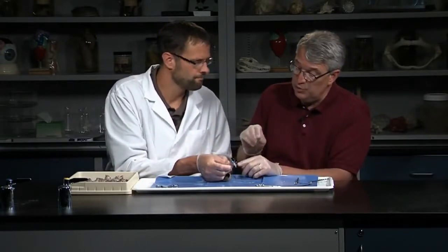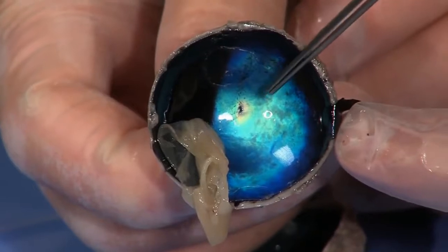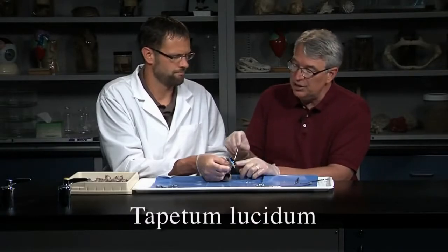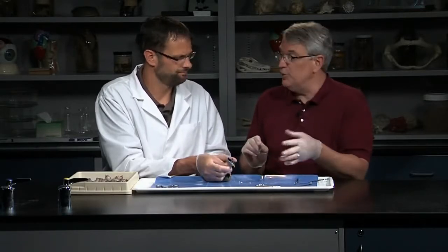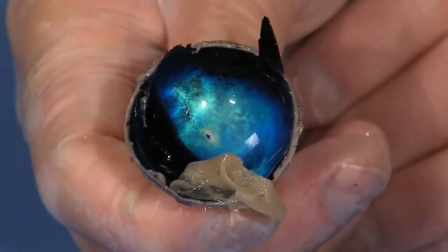Interestingly, this is one difference between cow eyes and human eyes: cows, cats, and other mammals have a shiny reflective layer in the back of their choroid called the tapetum lucidum. The tapetum lucidum promotes the reflection of light rays, giving these animals much better vision in low light situations. It's also responsible for the eye shine you see when you shine a flashlight in an animal's eyes — reflecting off that bright tapetum lucidum. You would not see that in a human eye; it would be totally dark.